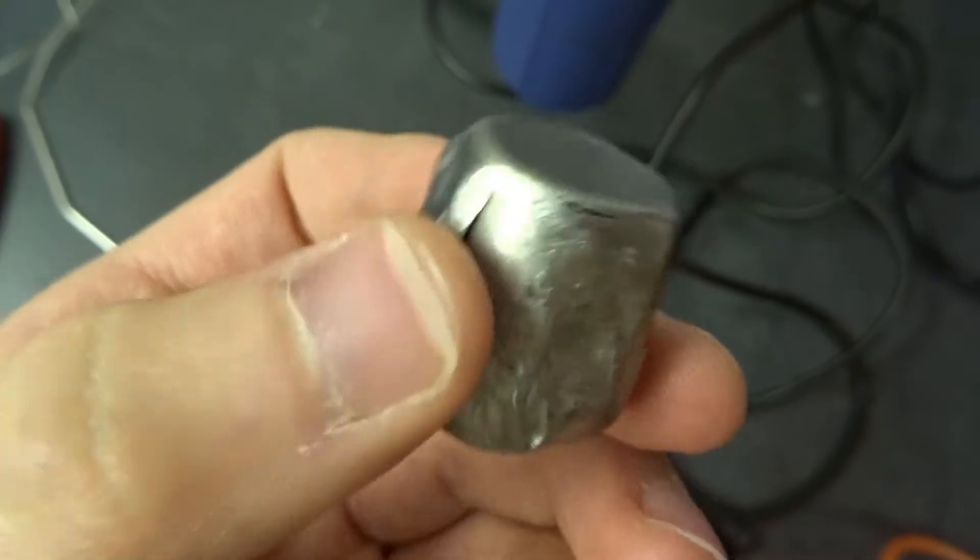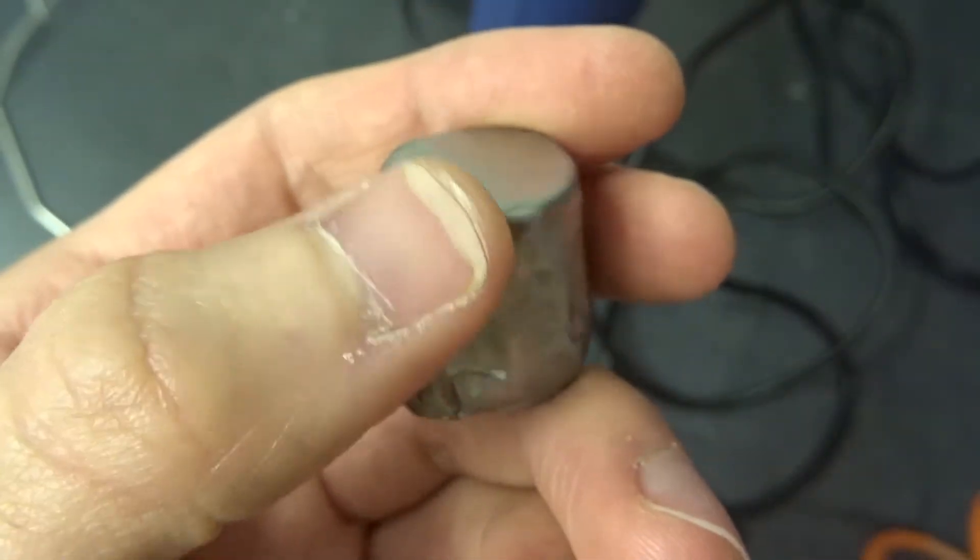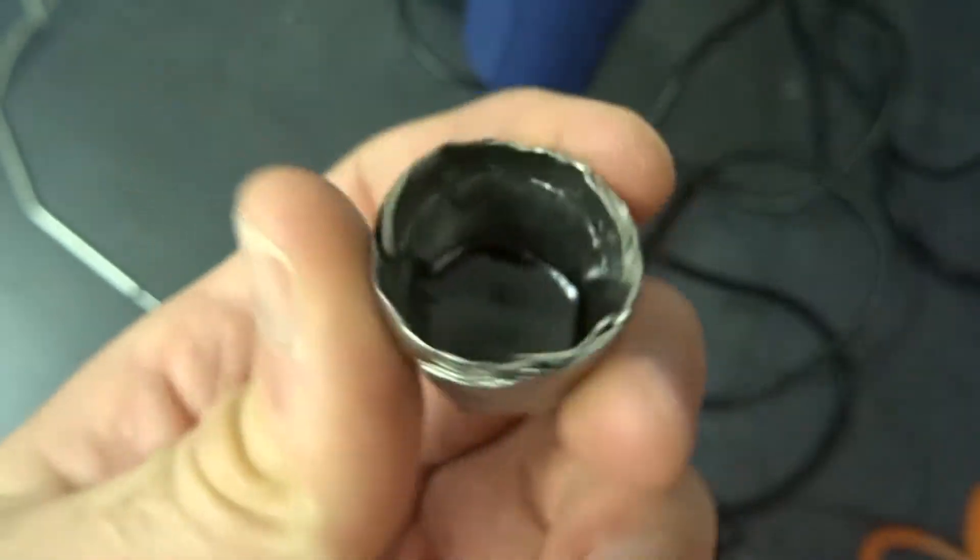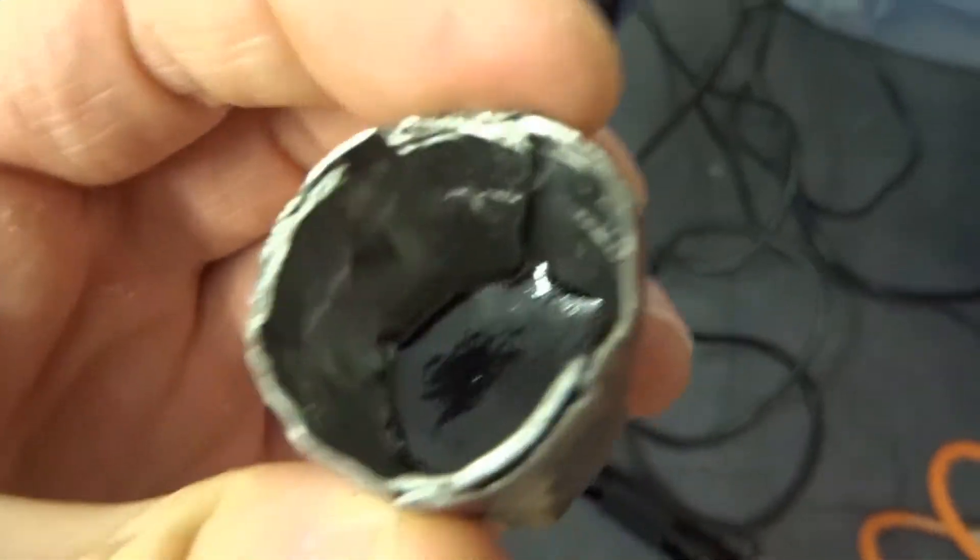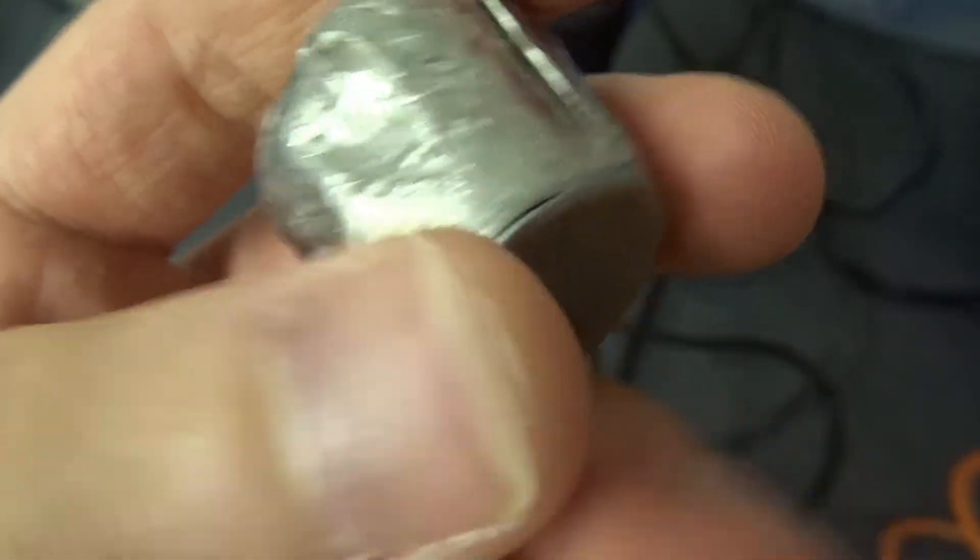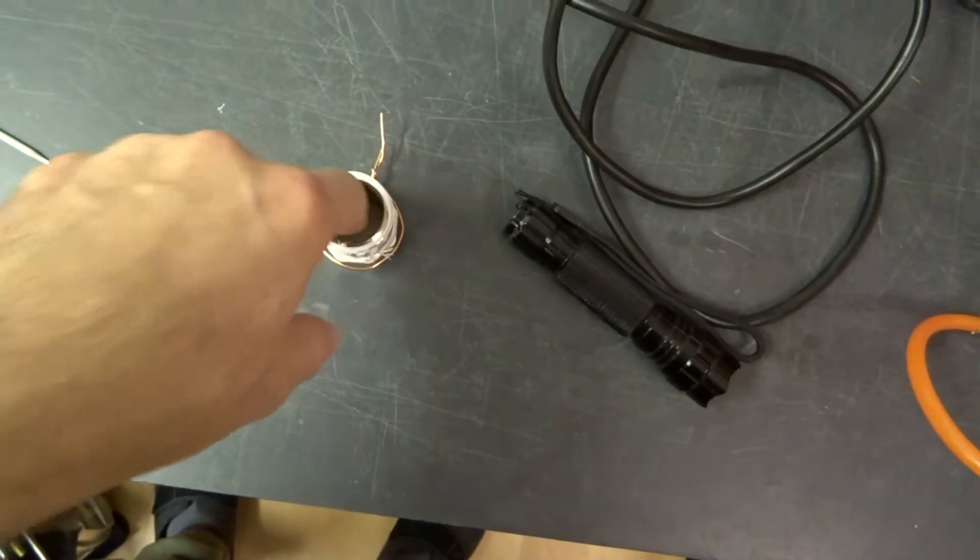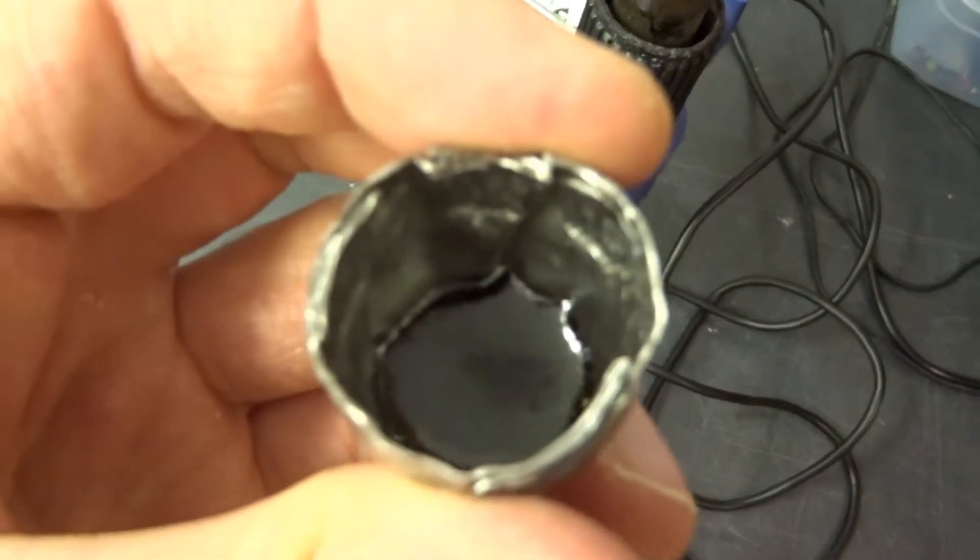There was some pressure in the bakelite forming. It kind of broke my little tin thing here, my little tin container. It broke, unfortunately. Fortunately, it didn't leak because cleaning out the stainless steel would be annoying. So this thing served its job.